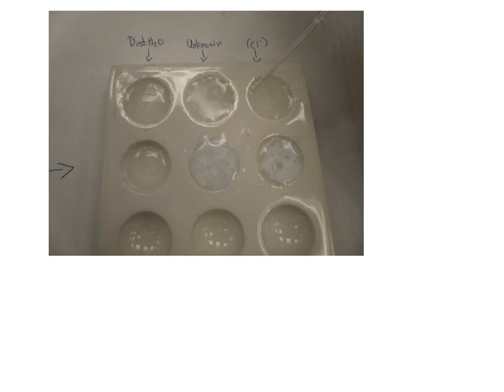These tests are only reliable if we add equivalent amounts of liquid to each spot. In this example, when you compare the amount of liquid in the distilled water spot to the spot with the unknown solution, you can see that someone has not done a very good job at adding equivalent amounts of liquid to the 2 spots.